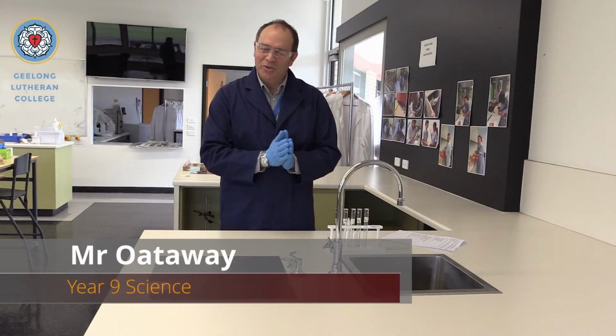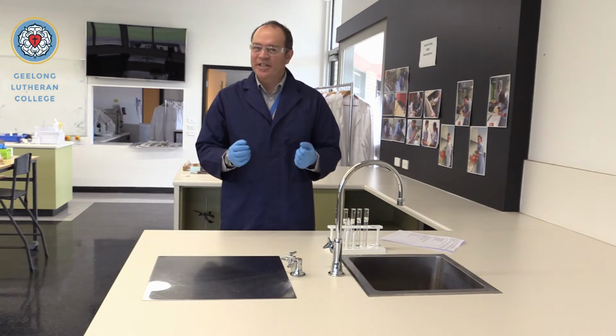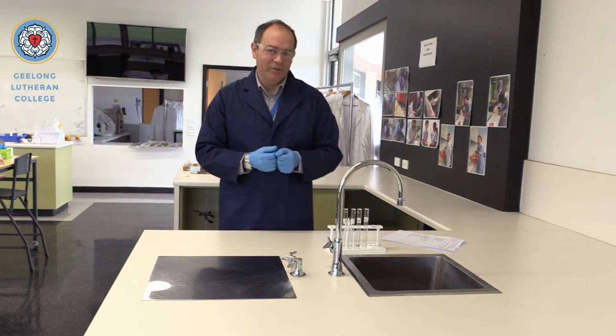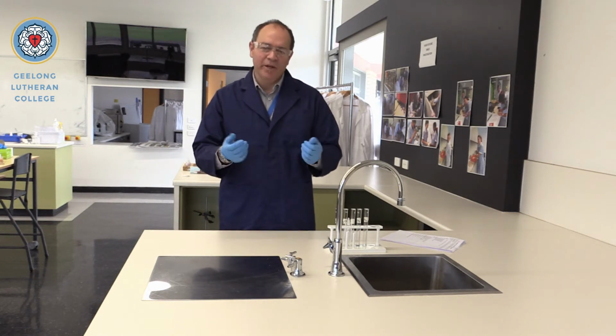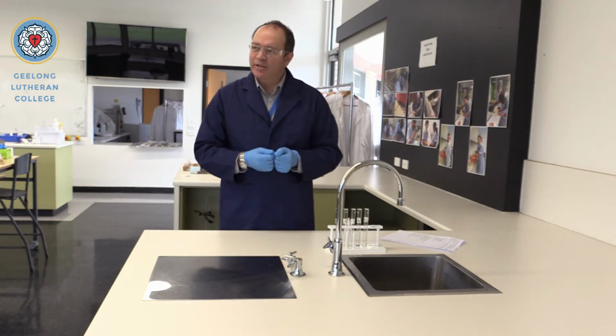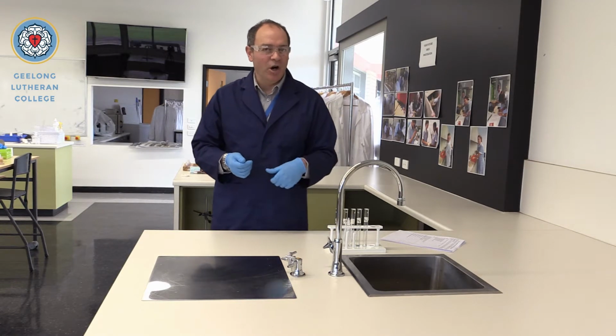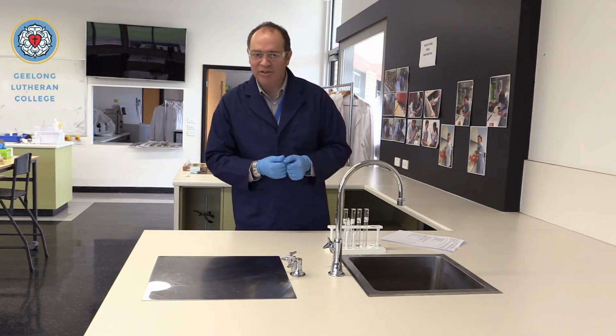We're moving on to a set of pracs now which will help us to determine the anion in an ionic compound. So this is the non-metal component of an ionic compound. And we're going to begin with the carbonate test. So carbonate comprises of carbon and 3 oxygens.